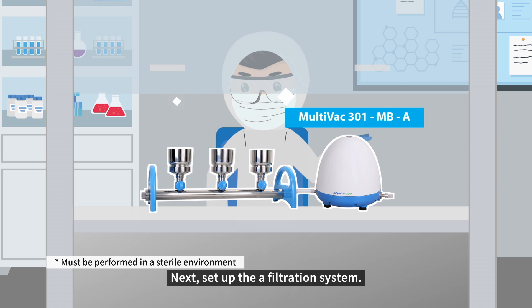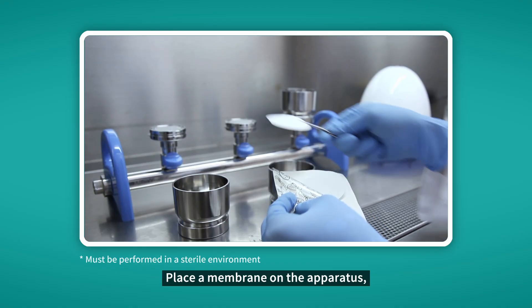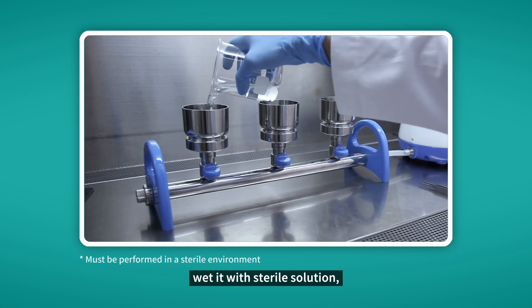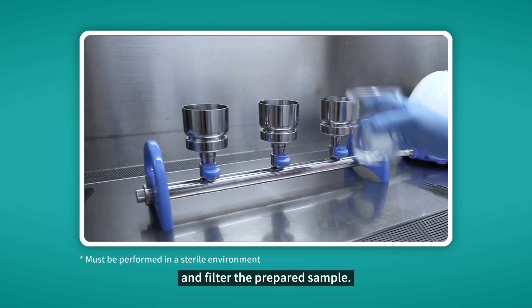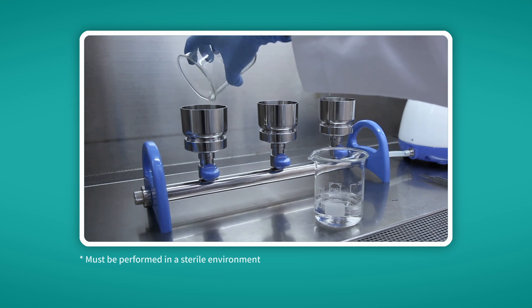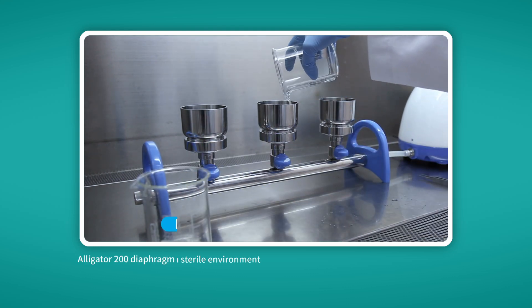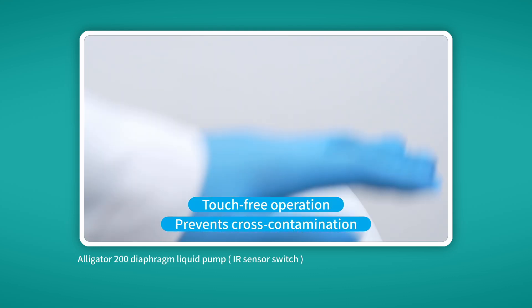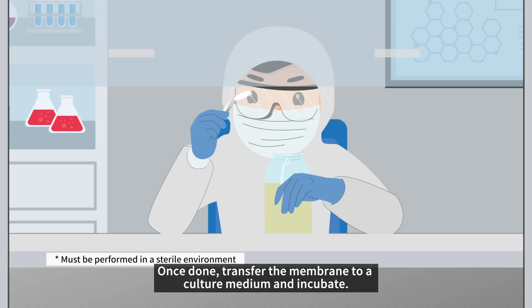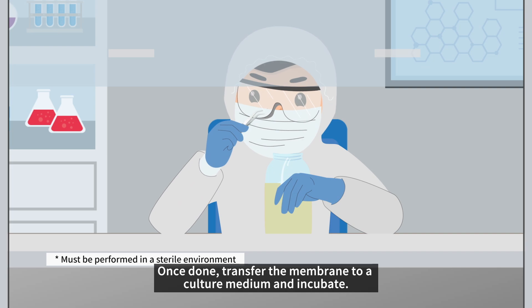Next, set up the filtration system. Place a membrane on the apparatus, wet it with sterile solution, and filter the prepared sample. Once done, transfer the membrane to a culture medium and incubate.